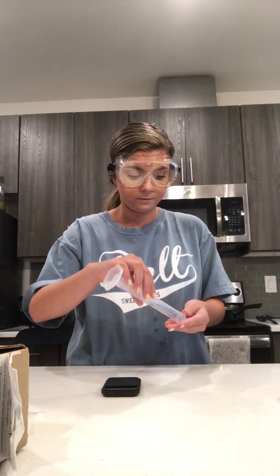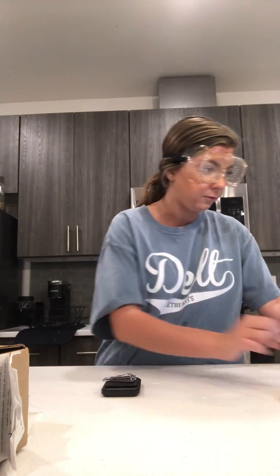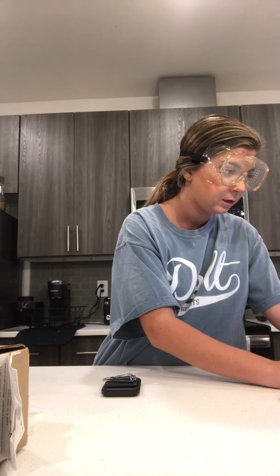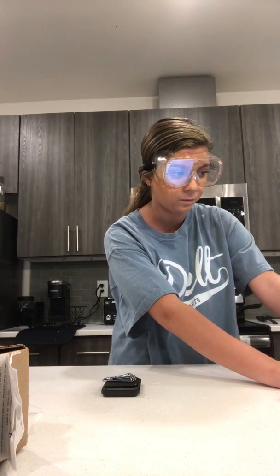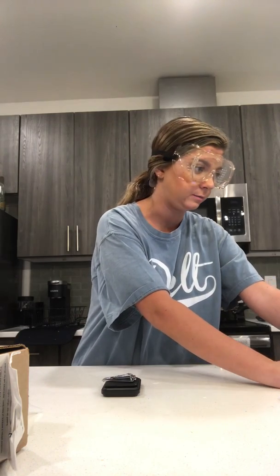And then now I'm going to measure just the mass of my nail cutter. And so the mass of the nail cutter is coming out to 40.10 grams. And my estimated digit would be 1. And then my number of significant figures would be 4, because I did 40.10 grams.